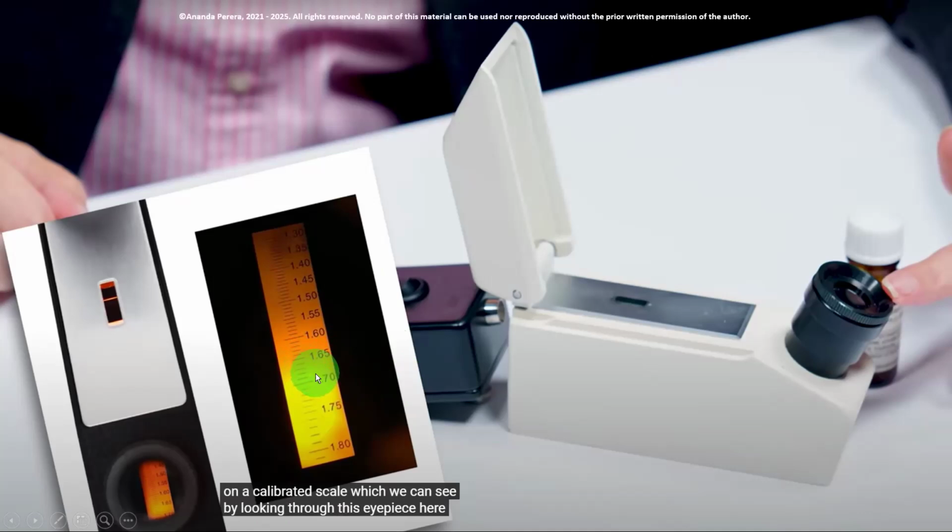When I look keenly, I can see 1.68 is the place separating the darker and the brighter area. That is the RI measurement. So the RI of the stone we put here is 1.68. That is the way we are checking.